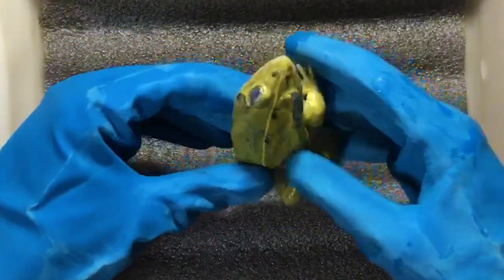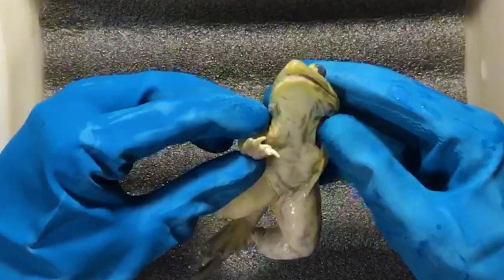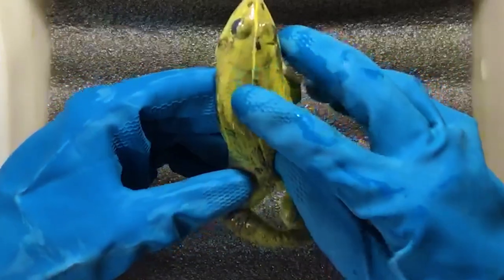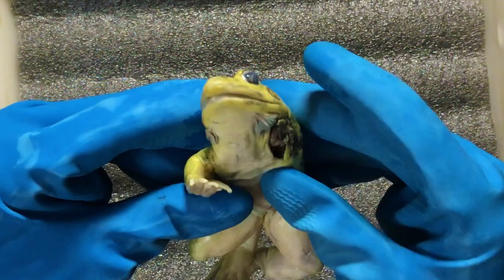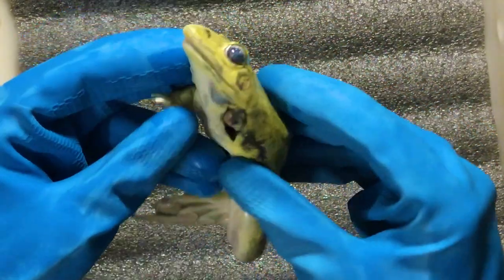Morphologically, its condition is not bad. Only the upper left limb is missing and I guess a few vertebrae are also broken. In the eyes there is a nictitating membrane, and pores all around the body for mucus secretion.